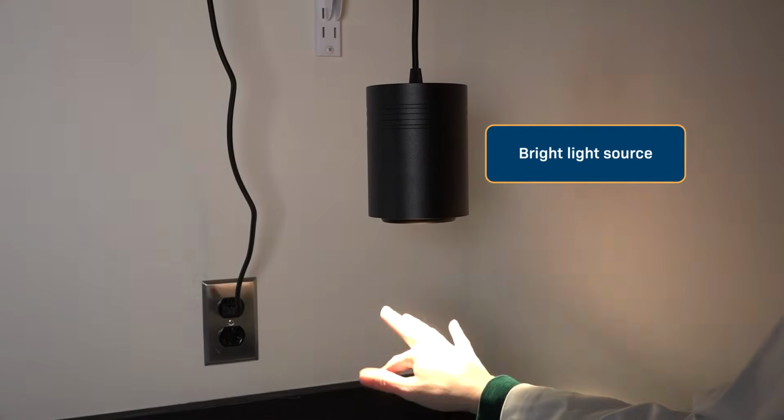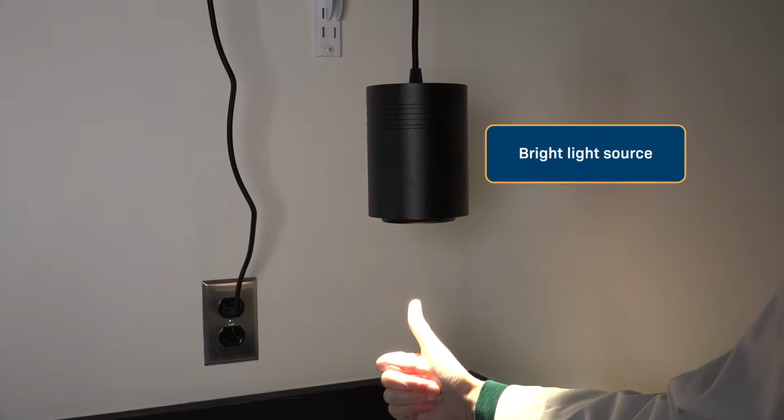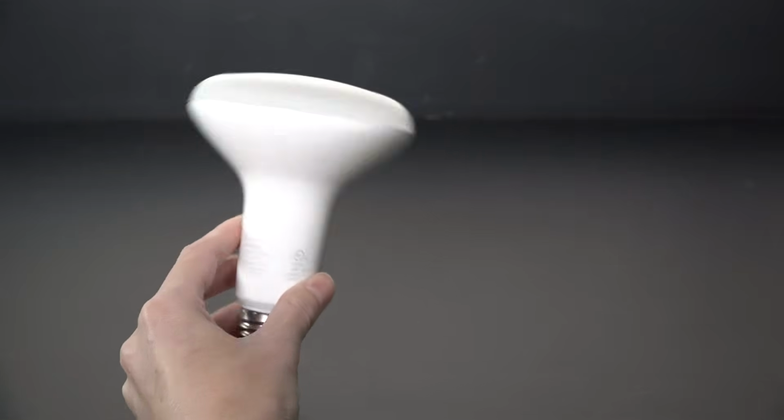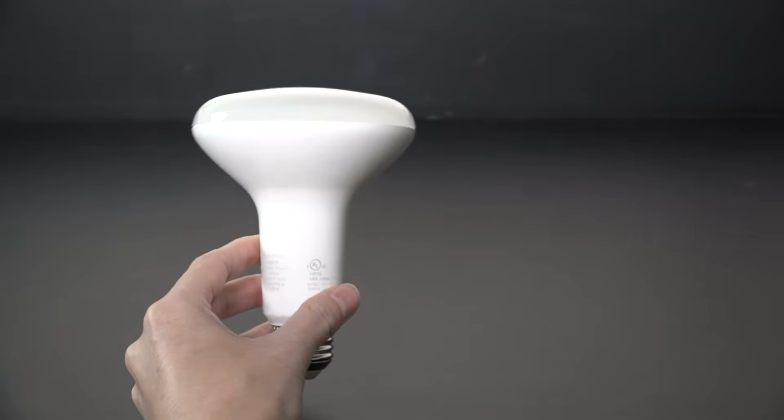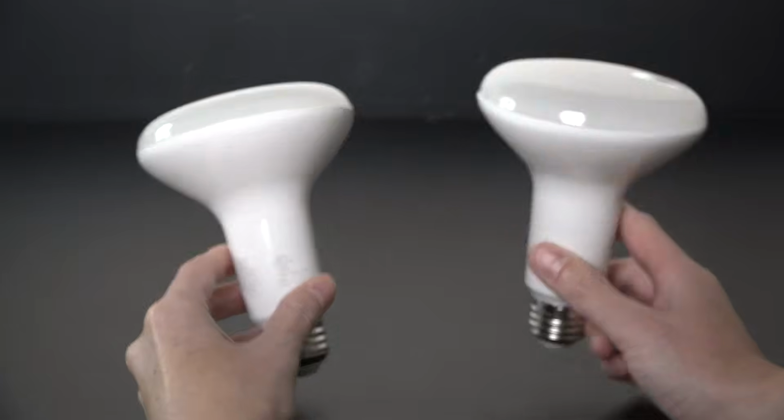I'm using a grow light, but you can also use a desk lamp. Just make sure the bulb is super bright, something like 100 watts. And if you want to compare results across multiple experimental setups, the light source must be the same wattage across all of them.